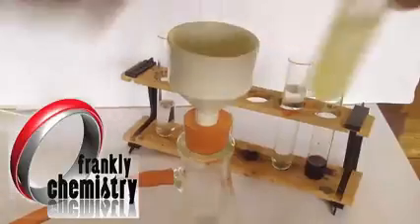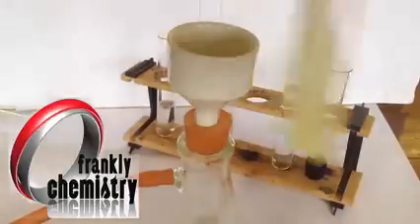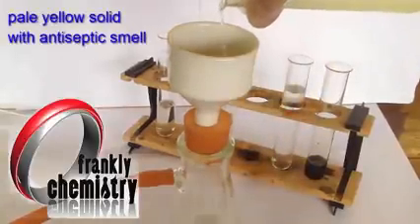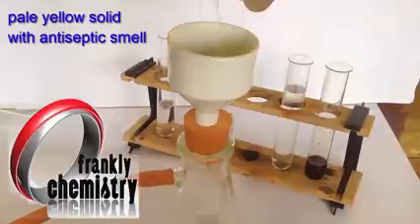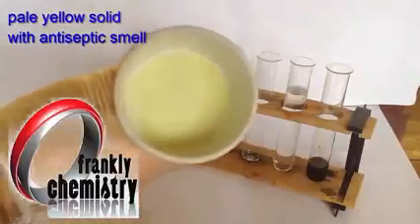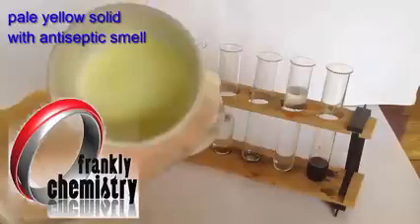You can see actually the solid there has precipitated to the bottom. That's the triiodomethane, a pale yellow solid with an antiseptic smell. Pour this in as well, just to be able to show you what the solid looks like. And there it is there on the filter paper.